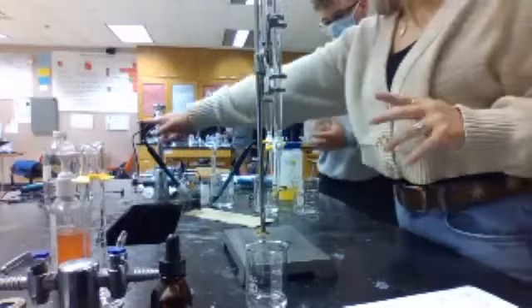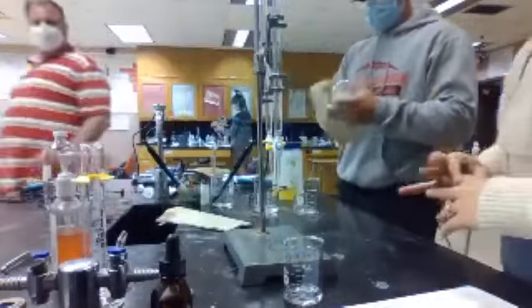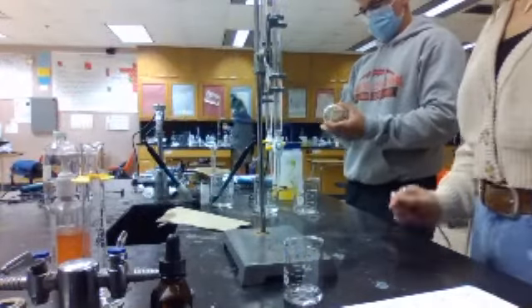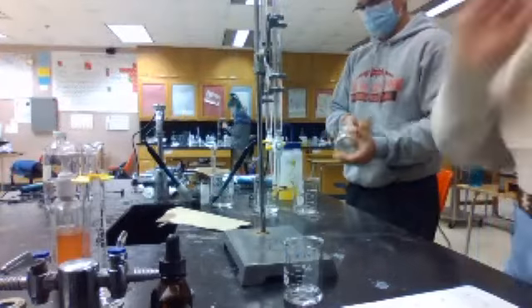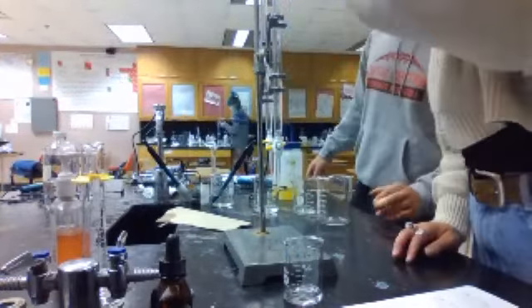Is that the acid? Yeah, that's the acid. Okay. What do you calculate? So what do you mean by keep the volumes, or keep everything the same? So now this is the initial volume of the next drop. Okay, so I don't need to pour anything else. Okay, so that's still 9.99.